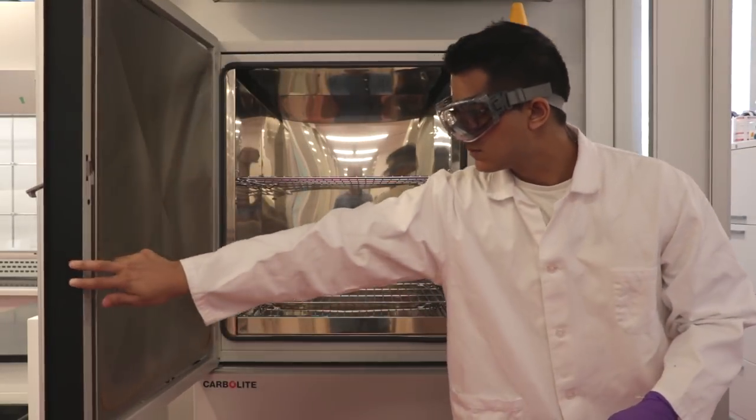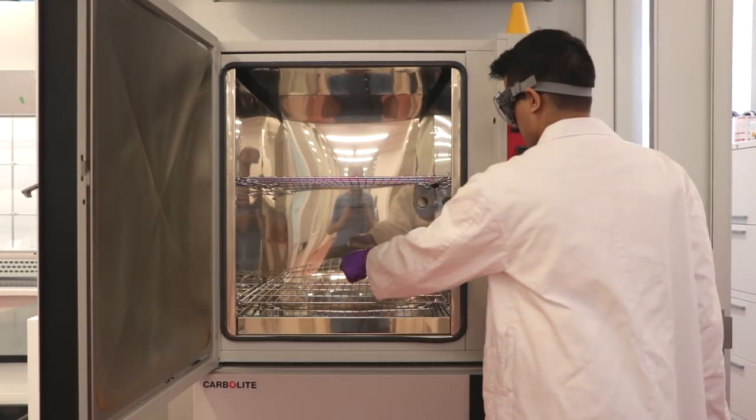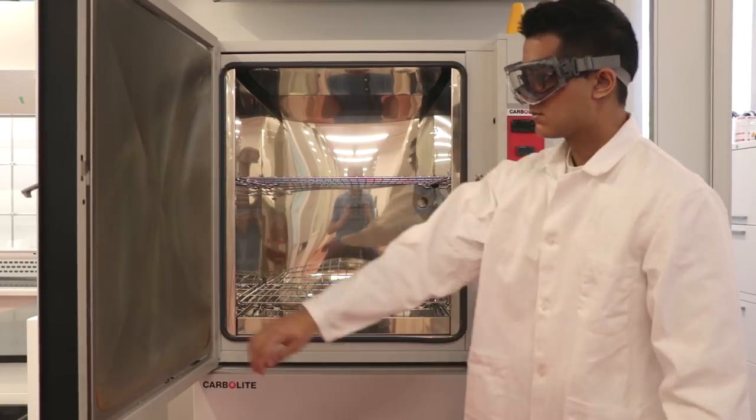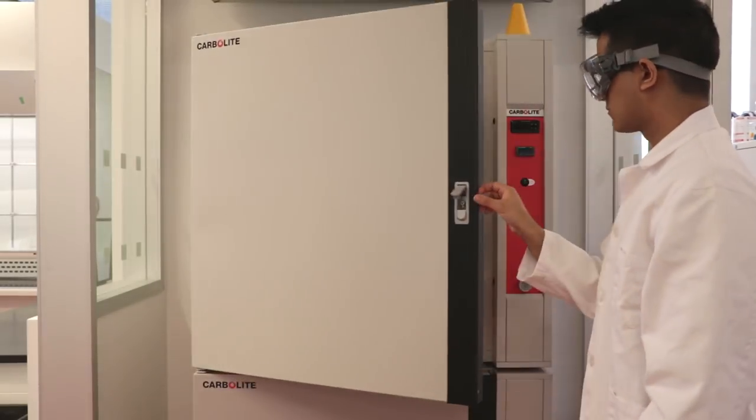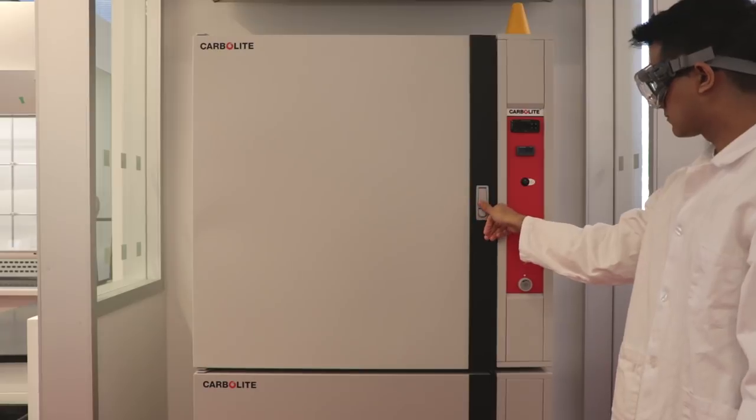Make sure you use an ungloved hand to open and close the oven. After the filter paper has cooled to room temperature, weigh it on the analytical balance.